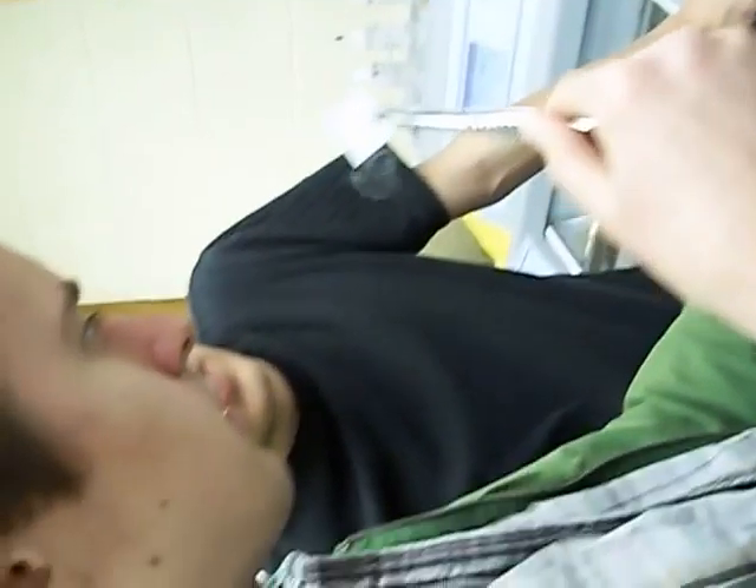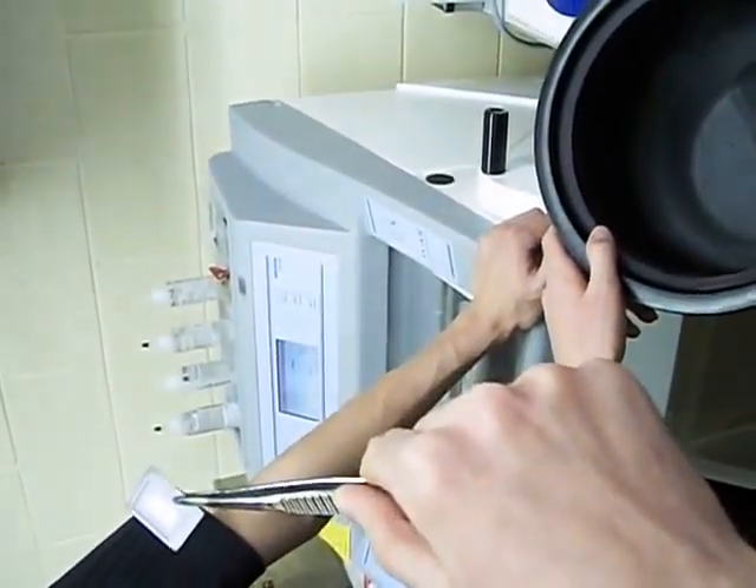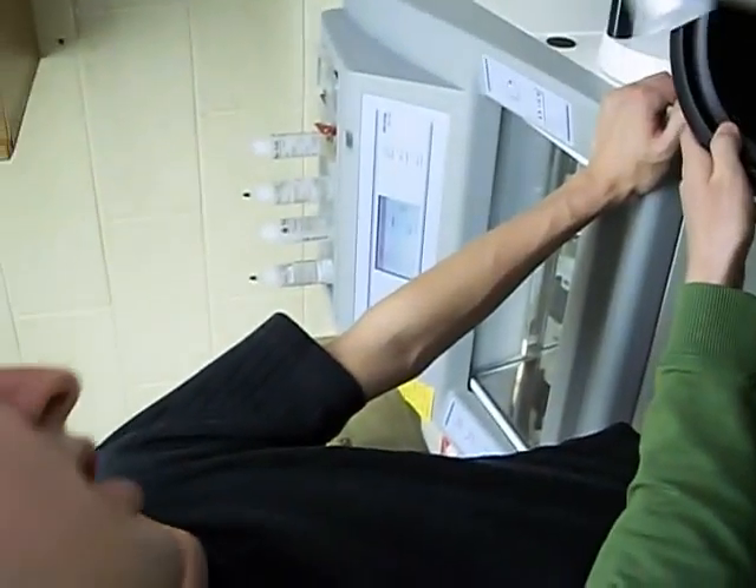You stick it in for an additional three seconds until it's completely white. That actually just looks like a bubble, so I think I'm just going to leave it. Bubbles are bad in sectioning, but there's not much we can do at this point.